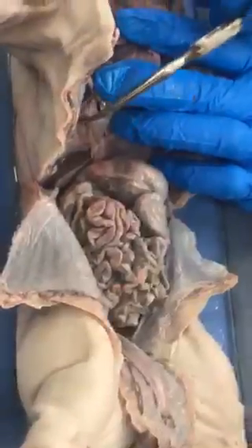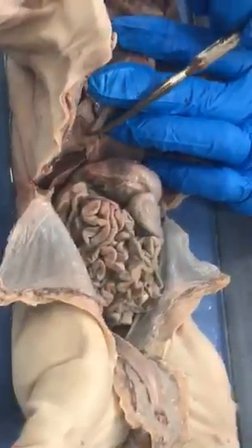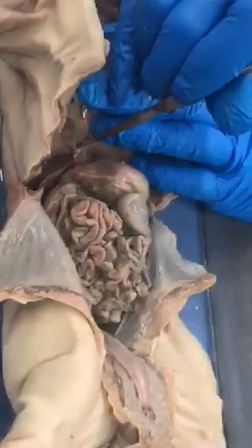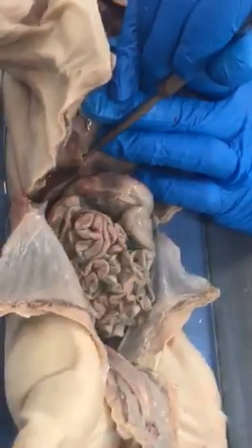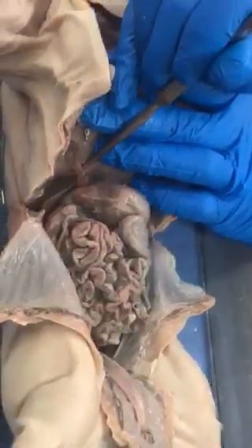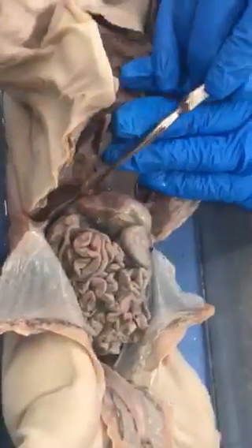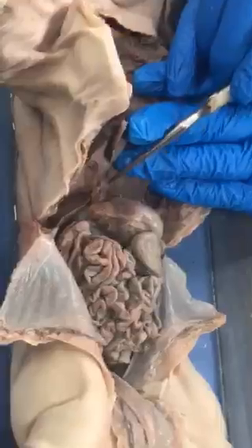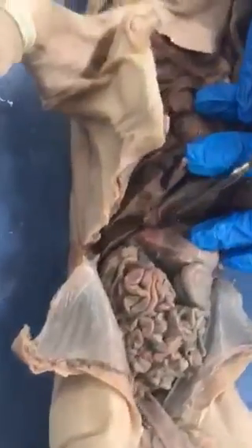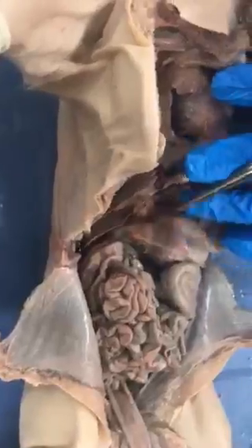Here's the liver. On the underneath surface of the liver, the inferior surface, is the gallbladder. And the cystic duct is the only one of the ducts that I would ask you about, which is this one coming off of the gallbladder. So you can cross off common hepatic and common bile duct. The lesser omentum is the mesentery that runs between the underneath side of the liver and the lesser curvature of the stomach. Okay. This is the stomach.